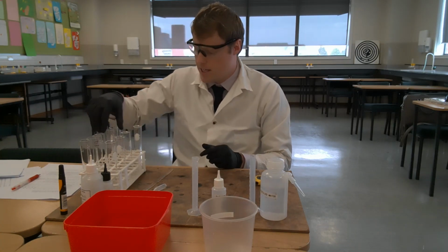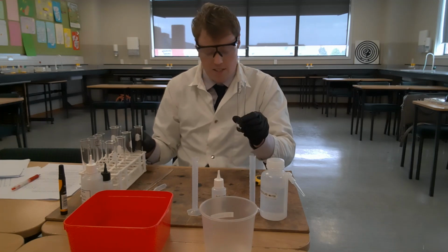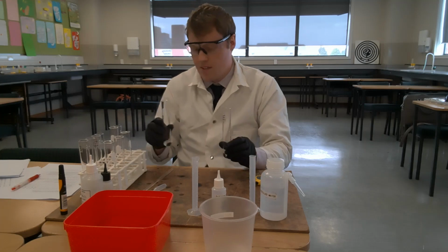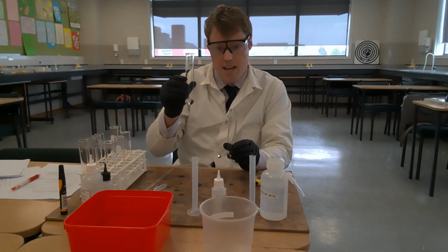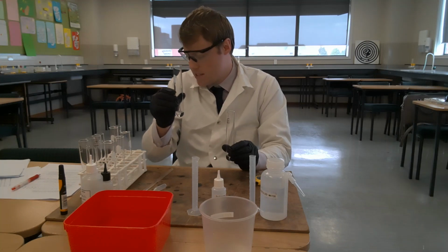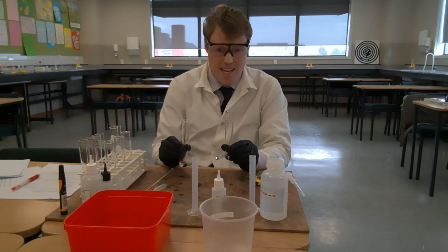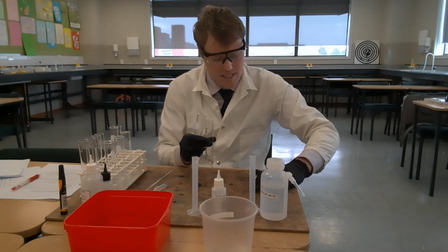So, take tube E. Got tube E in my left hand, on your right, I suppose. And I have this solution here, which contains 1 millilitre of hydrogen peroxide and 4 millilitres of distilled water. I'm going to add this solution to tube E, start the stopwatch, and we'll see how long it takes to turn blue.